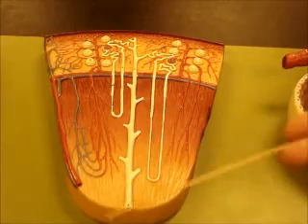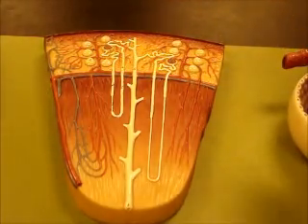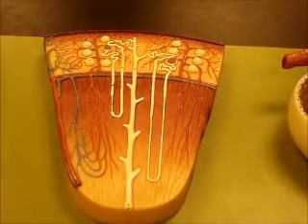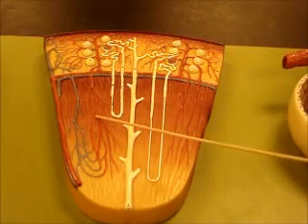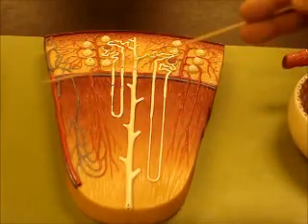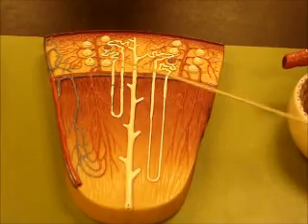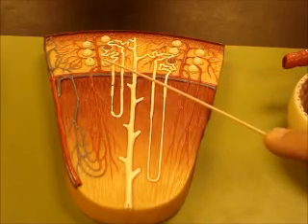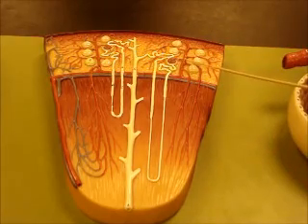Alright, this one right here is showing you one large renal pyramid. You've got the cortex associated with that. Here's your renal capsule. Here's your arcuate artery and vein separating the cortex from the medulla. This would be an interlobar artery and vein. Off the arcuate artery, you have your interlobular arteries here. Those interlobular arteries are going to give off small arteries called afferent arterioles.